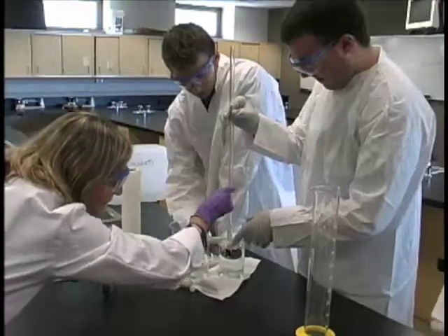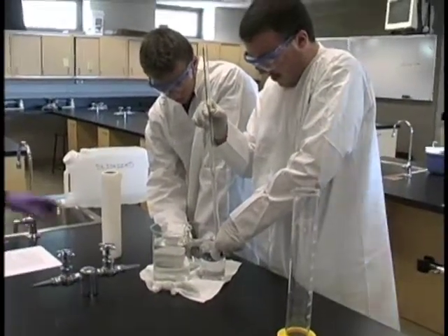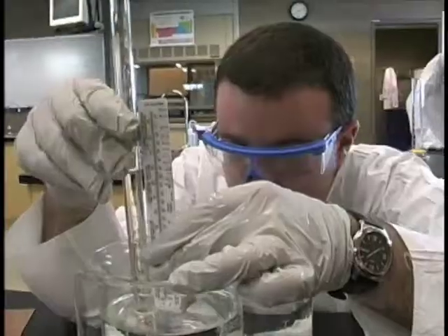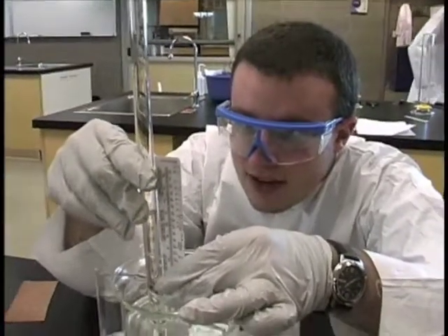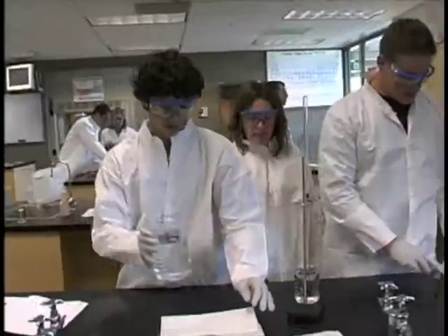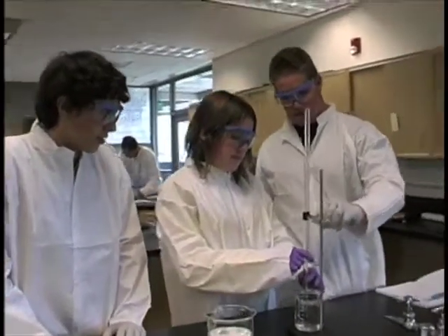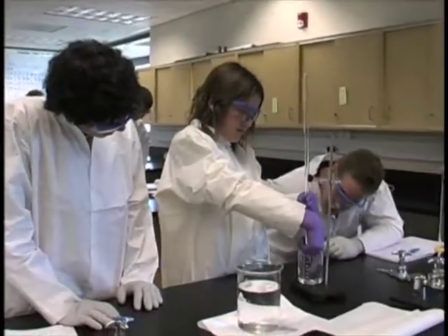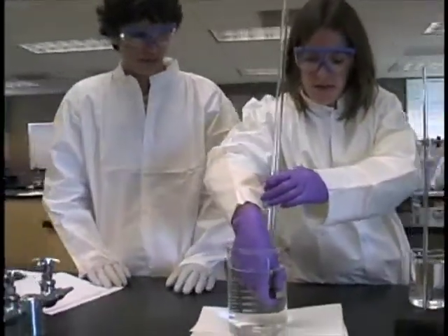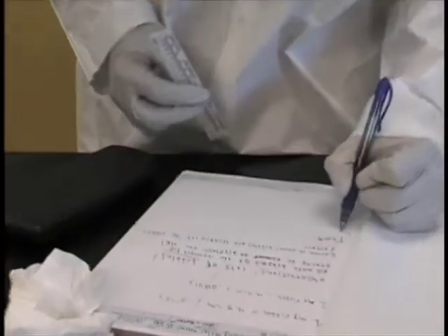Now, put those there. There you go, and let go. All we're trying to do is equalize the pressure. 10.5 centimeters. Here's the thermometers. You have to write down the difference from here to the top of the water. 20.3.